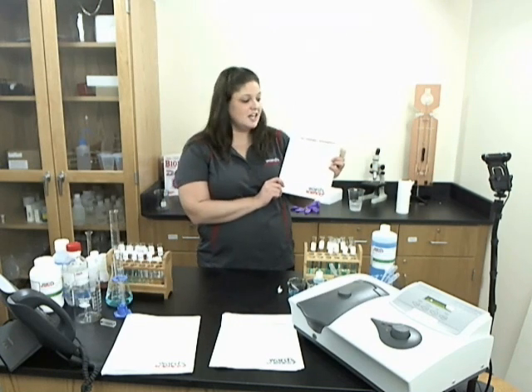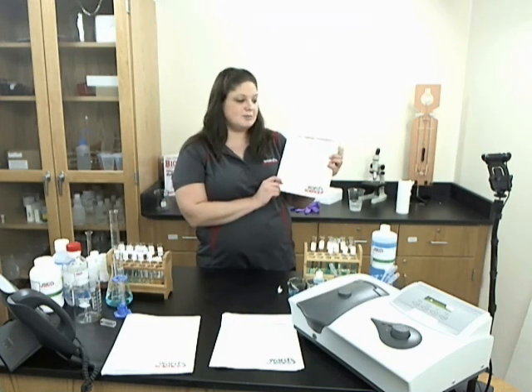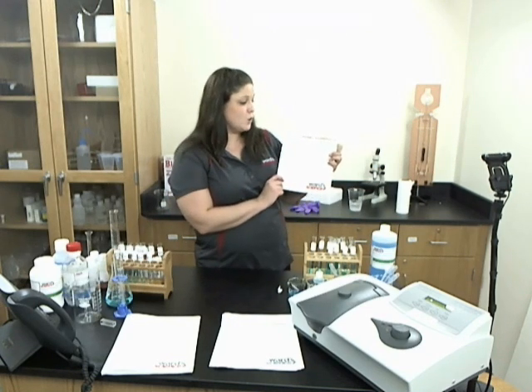Hi, my name is Dr. Liz Hoffman and I'm one of the product developers here at Ward Science. Today I'd like to introduce you to one of the AP chemistry investigations that we developed to align to the new College Board Standards. This is AP investigation number one, spectroscopy. What is the concentration of that solution?